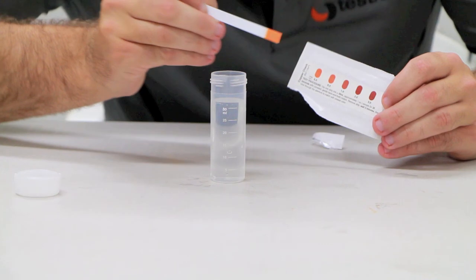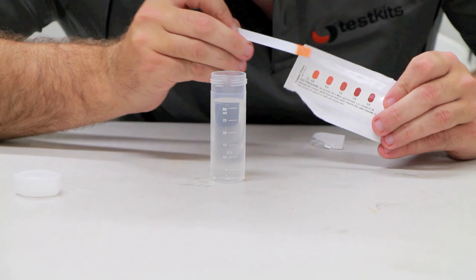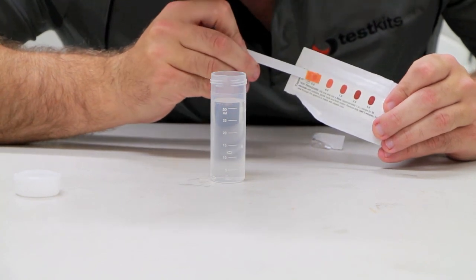After waiting 2 minutes, put the strip up against the chart and match the colour of the strip to the closest one on the chart.